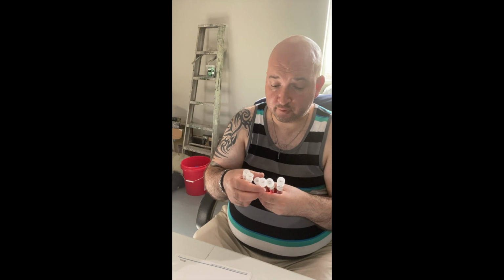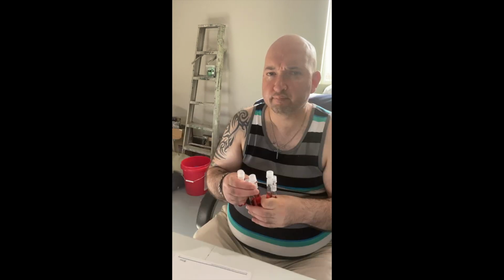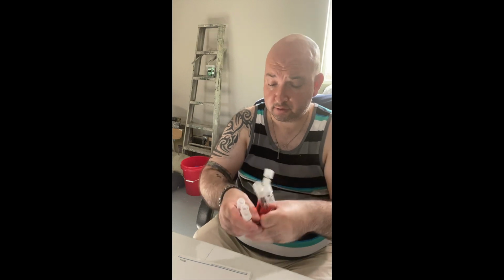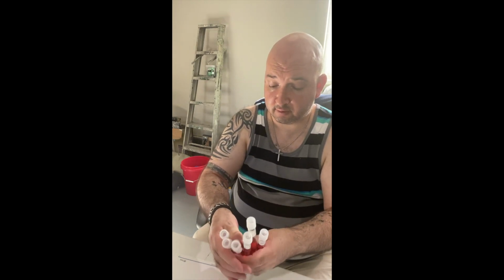So I have a pair of tubes called number 1 for S. cerevisiae and S. epidermidis, a pair of tubes number 2, S. cerevisiae, S. epidermidis, and then the last pair, number 3, is for mannitol. I may have the numbers wrong, but basically there's a pair for glucose, a pair for fructose, and a pair for mannitol.